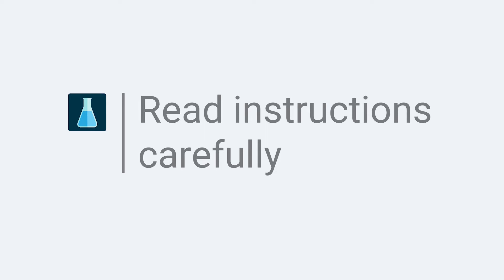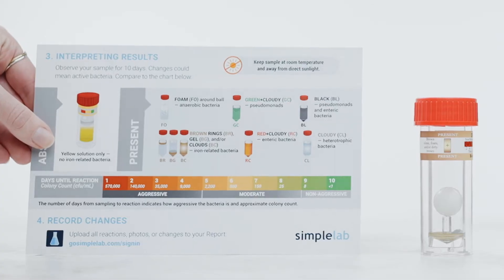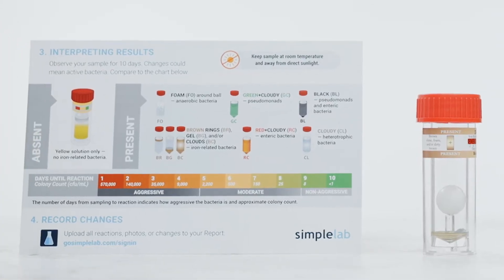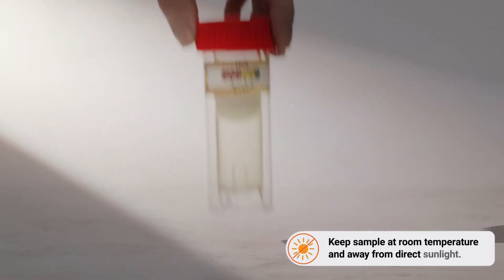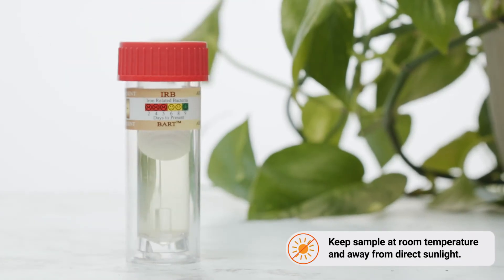Every self-test is unique, so it's important you read the instructions carefully in order to get the most accurate results. Once you've collected the sample, place it in a well-lit room away from heat and direct sunlight.